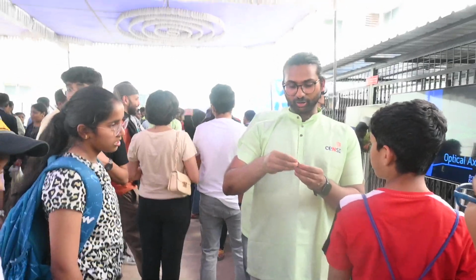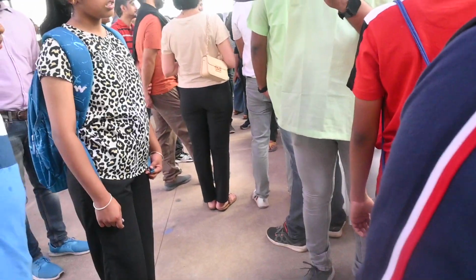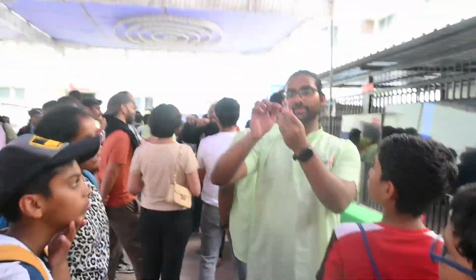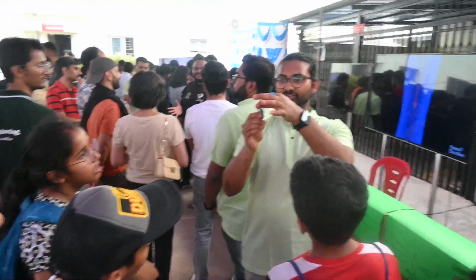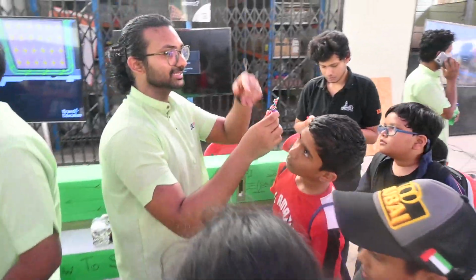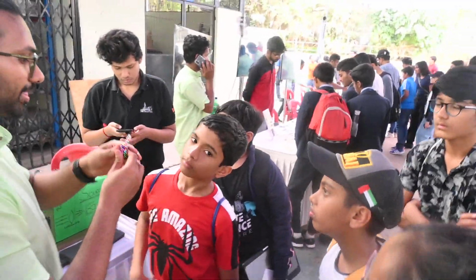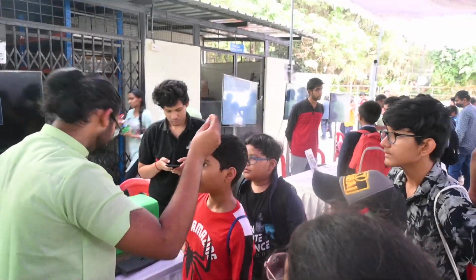We'll keep cutting it off, and you will finally end up with something like this. It will be thinner here, and it will be thicker here. What we are interested in is the thinner portion. This thinner portion is electron transparent. It's like the thin slice of onion. This is what gets imaged.